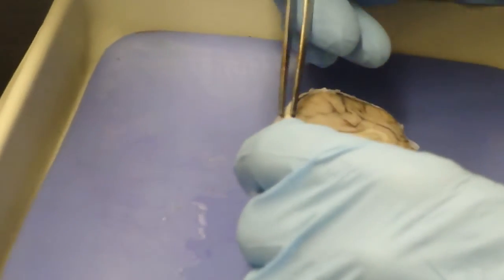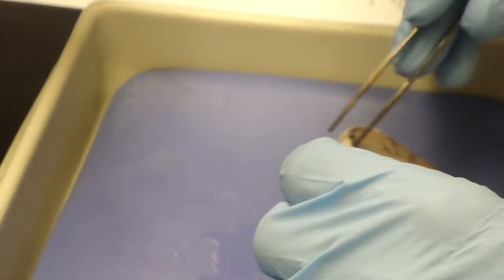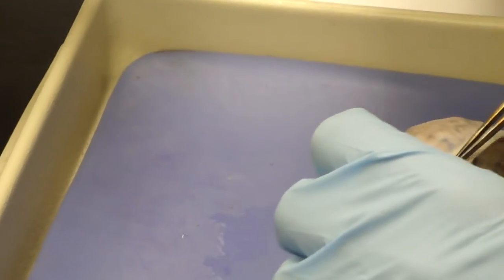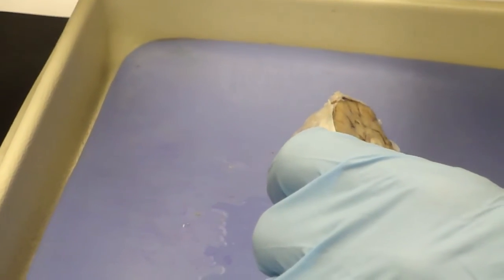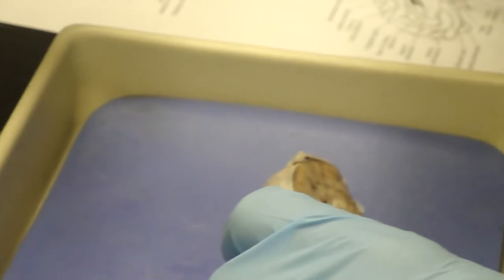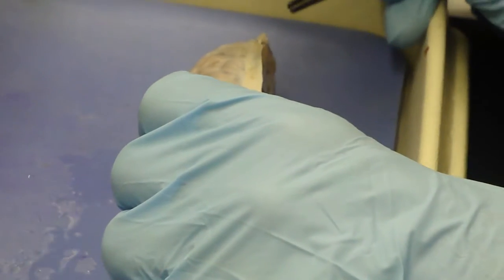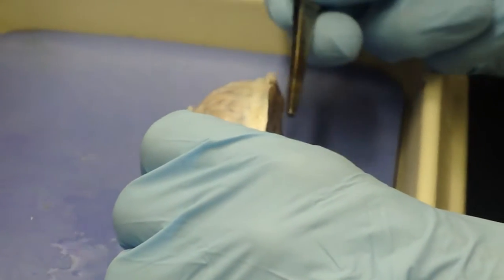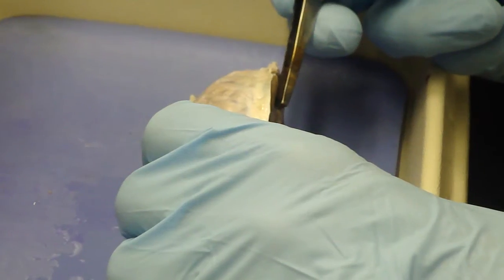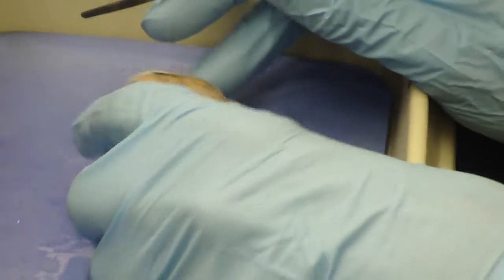You will end up taking off the membrane, and you can see it's got quite a deep division. Which sulcus have we got there in the middle? What is it that separates the two cerebral hemispheres? The central sulcus? No. Well, it'll be in your book. It's just not coming to me at all.